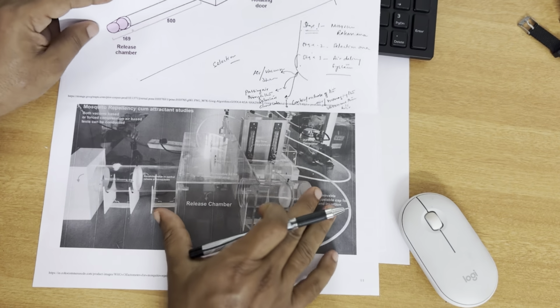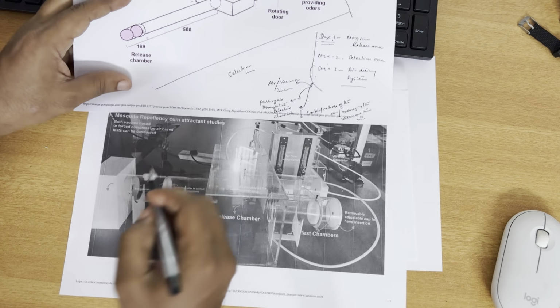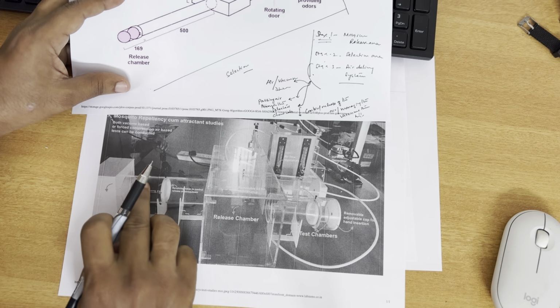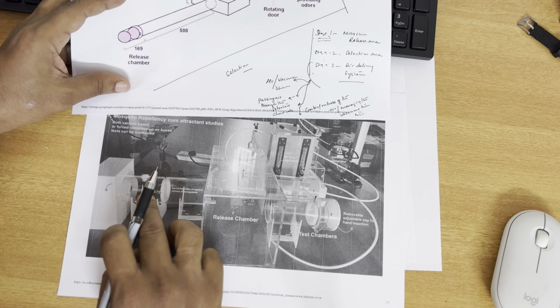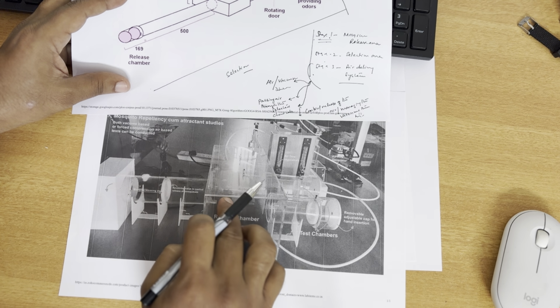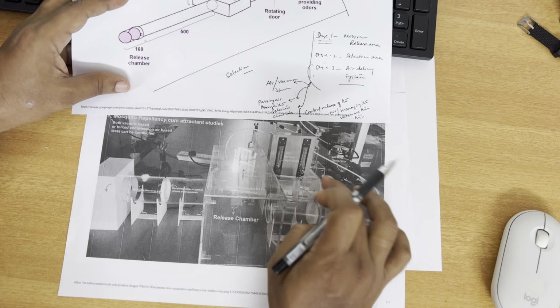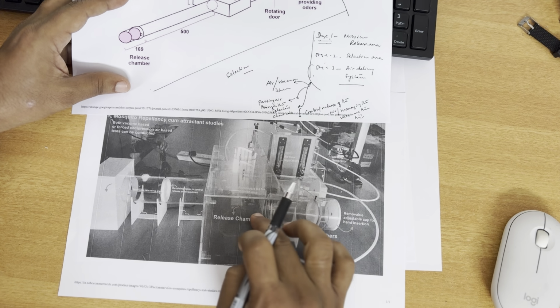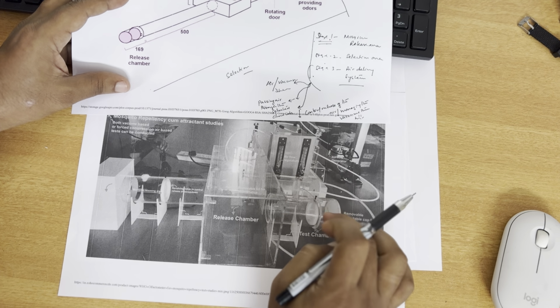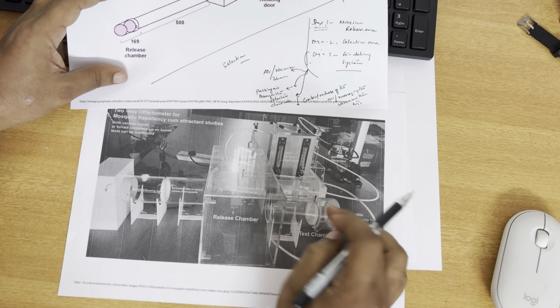The third part I'm going to show here. If you see, this is the one I talked about: mosquitoes will be released here, then they can be held here for some time. Once you rotate the window, the mosquitoes will enter into the selection chamber. From this selection chamber, the mosquitoes will go either from here to here or here to here. This is where the selection happens. This is the two-way selection olfactometer.